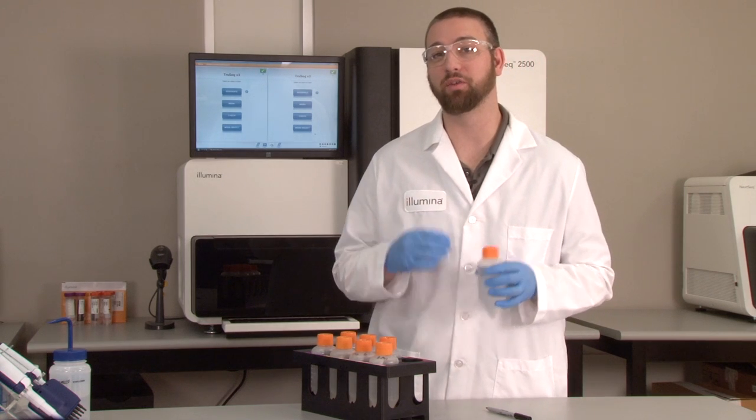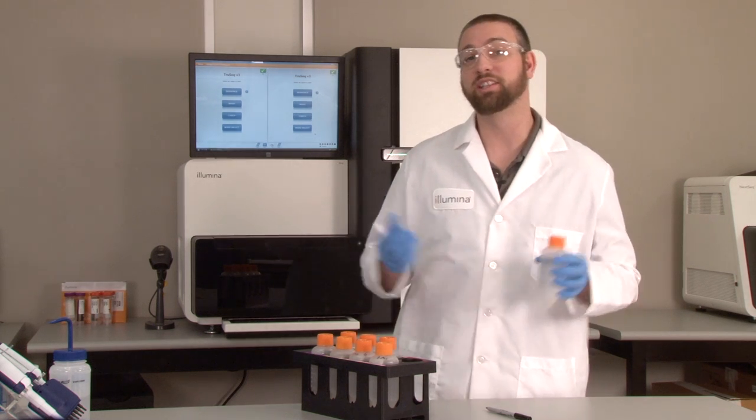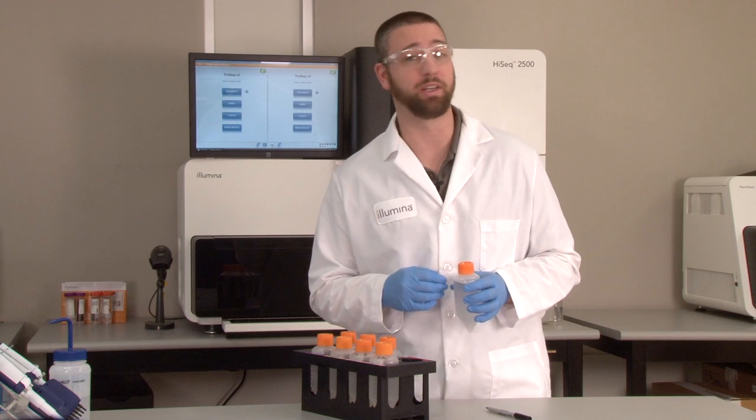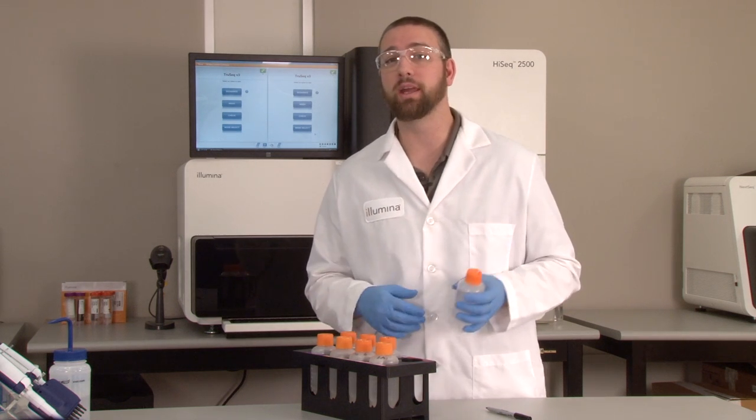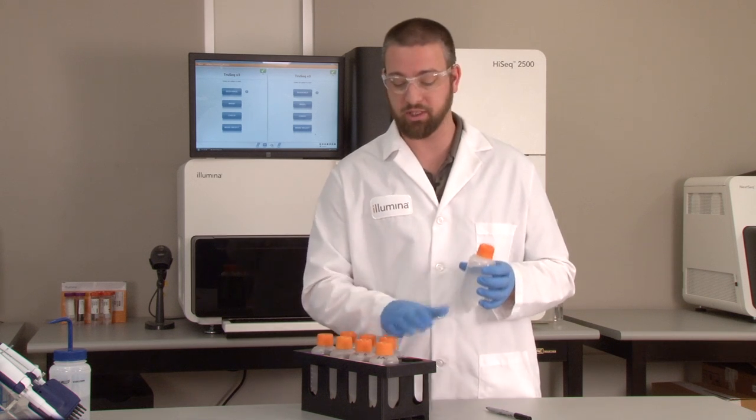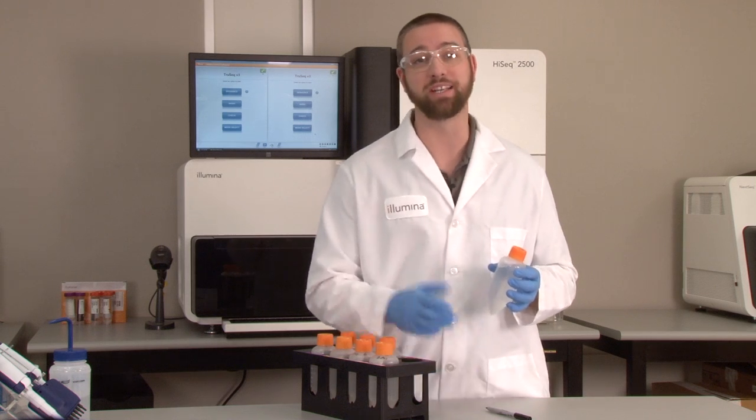Be sure to follow the guidelines for washing your Hi-Seq instrument as listed in your appropriate user guide. Simply put, for better long-term performance and uptime, be sure to wash your Hi-Seq routinely. We also recommend labeling the water or wash bottles and tubes by their numbered position in the rack. This prevents any cross-contamination between reagent positions.